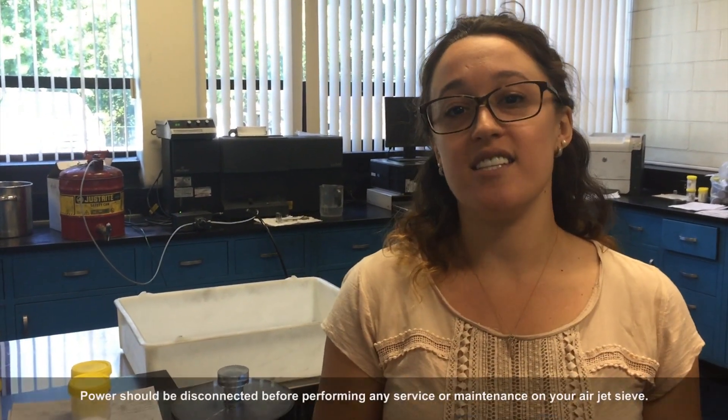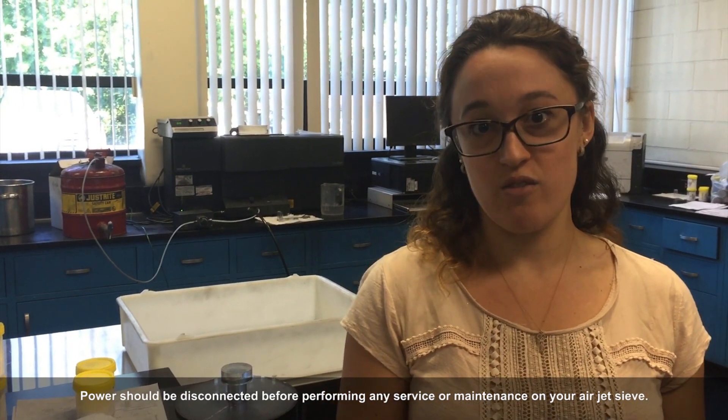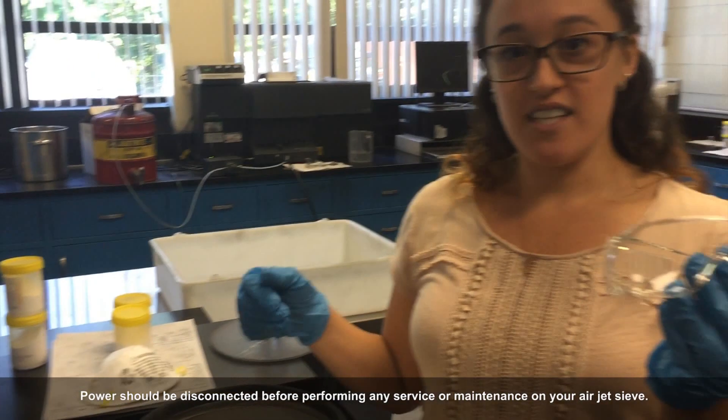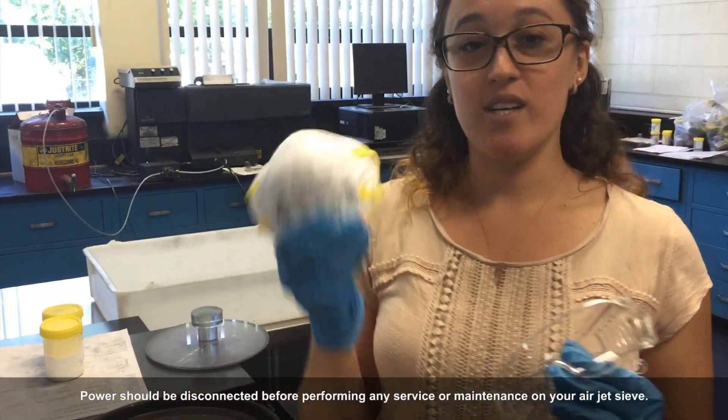As a point of awareness before we begin today, I just wanted to let you know that we are in a working lab, so should you see people walking back and forth, that's normal. You want to make sure before you begin this procedure that you're following your company's protocols on the safety equipment or the safety gear that you're required to wear, such as gloves, safety glasses, or a dust mask.